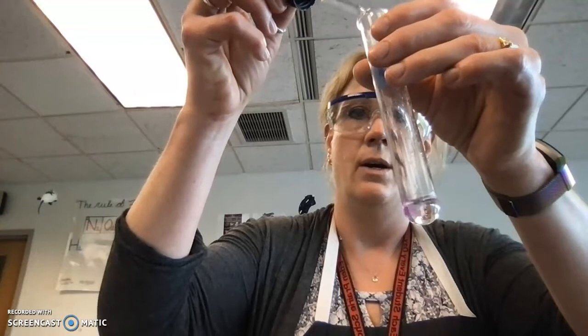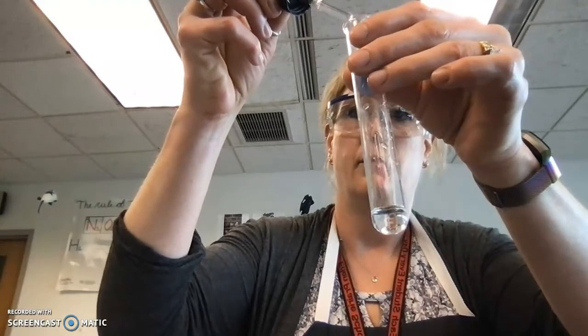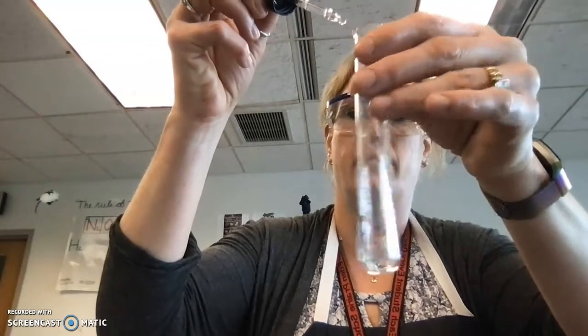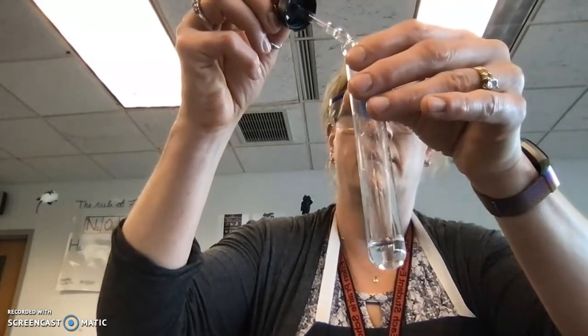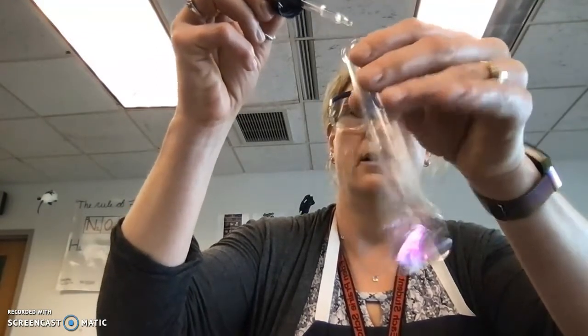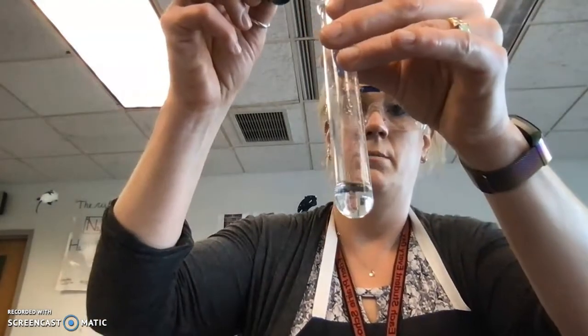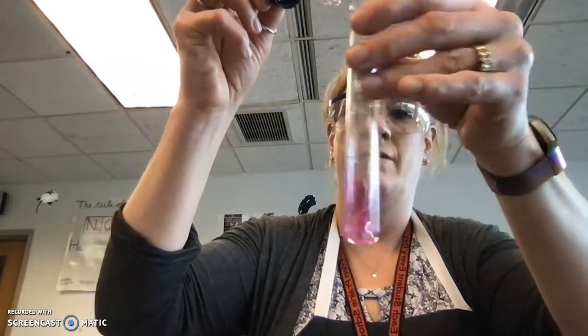So 1, 2, 3, 4, 5, 6, 7, 8, 9, 10, 11, 12. Oh, we're getting there. You can see it's turning pink, but not wanting to stay pink. 13, 14, 15. There we go. So 15 would be what I would record in my data table for the first entry.